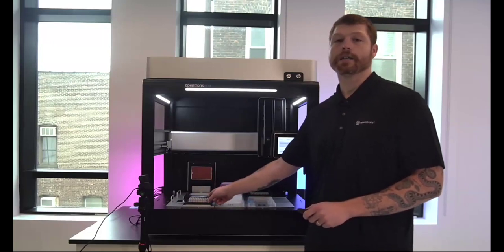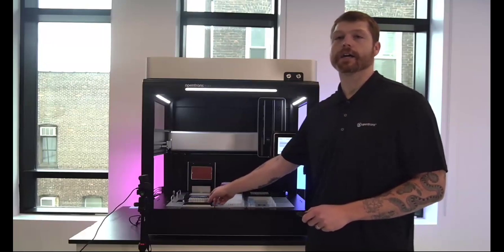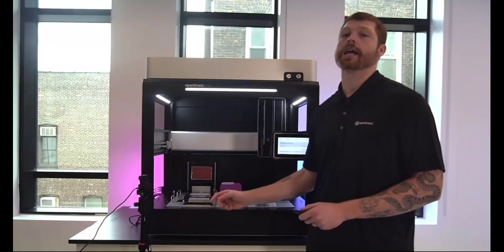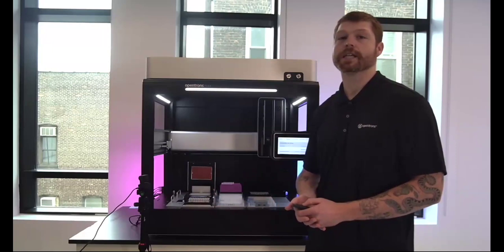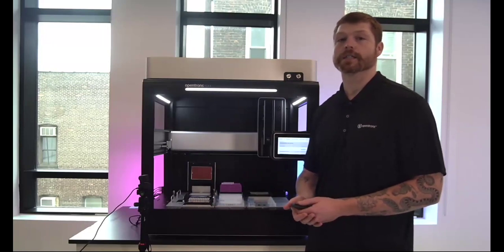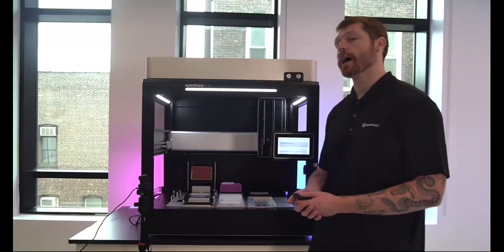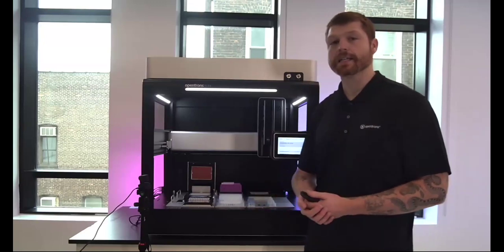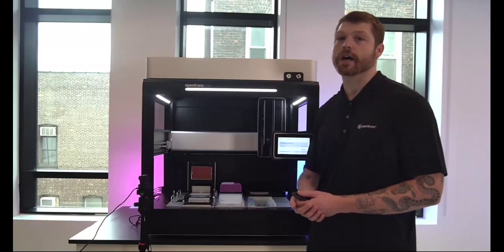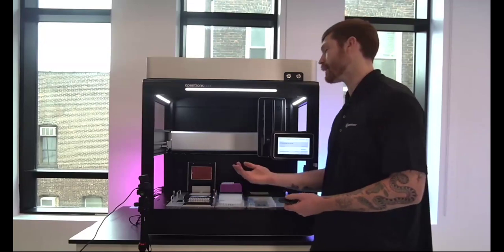Behind this, not quite as visible here, is going to be the temperature module, which also has a variety of adapters that can be seated for different labwares and has the ability to go from 4 to 95 degrees C. And then all the way at the back is the Opentrons thermocycler, which can automatically open and close via the software. It's a really unique offering for automating PCR and other workflows where thermal cycling is necessary. All of these modules sit in individual caddies that slot under the deck, so they offer great space savings on the deck, allowing you to move the pipettes freely around it.